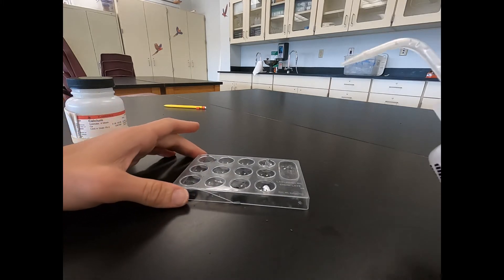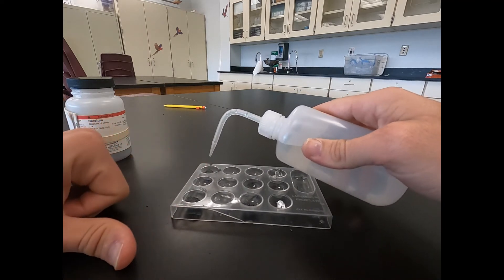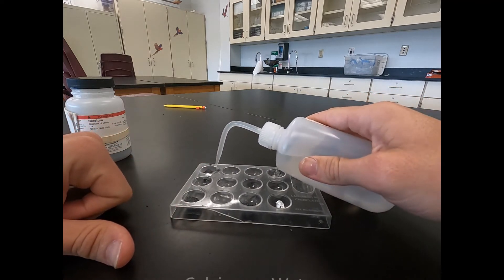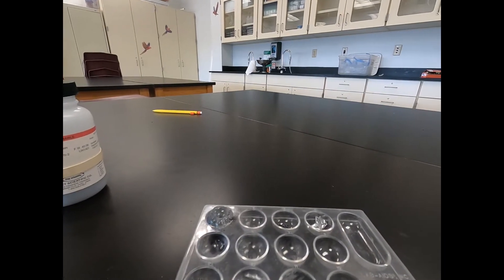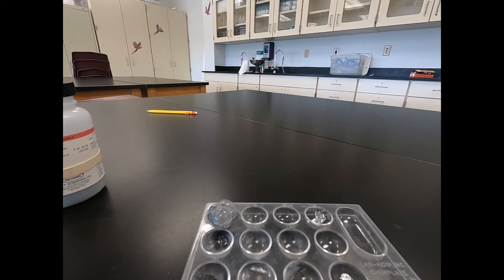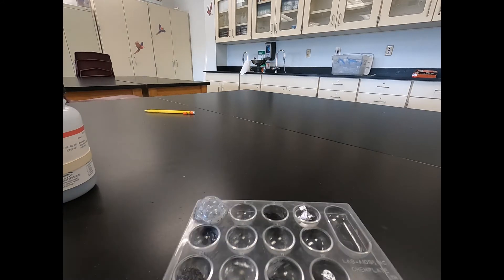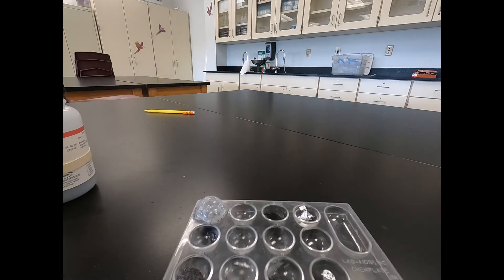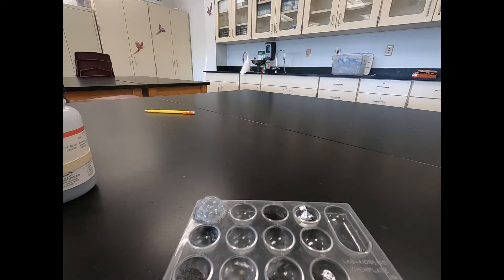And now we're going to react each one of our metals with water. So we'll start with our first one, calcium. We're reacting our calcium with water. Next we'll do our magnesium. And finally, aluminum.